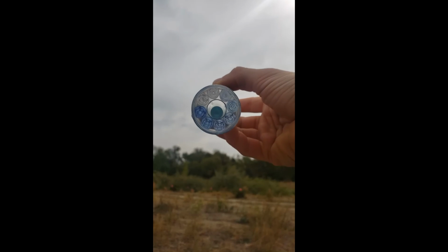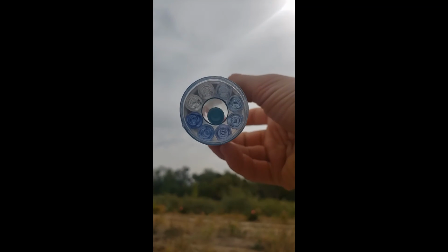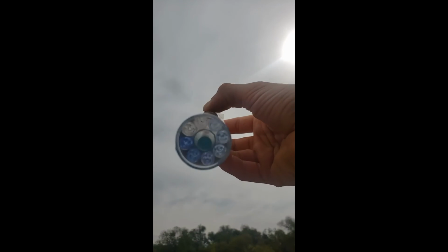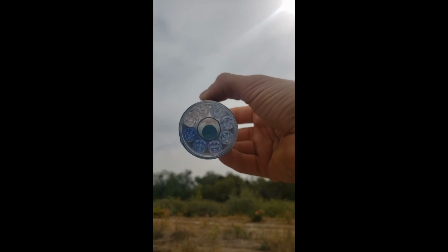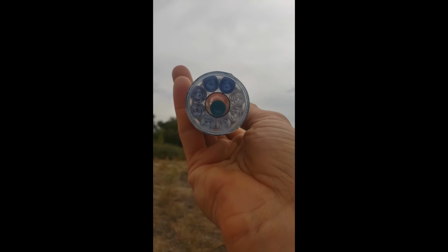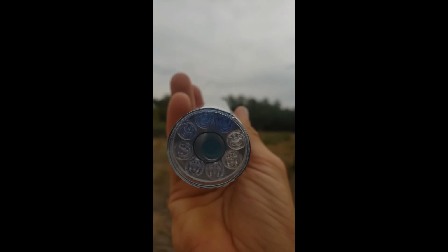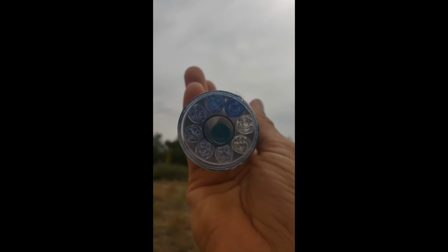It's hard to tell, but you compare this to the colors around it. Oh yeah, you can actually definitely see a color change. So I'm maybe gonna make the decision, ooh, it's like a different color blue, but it's a little bit darker. So I'm gonna go around and see that darker blue is at 0.8. See if you can see that. This goes to that. Alright, and if this is getting frustrating that you can't see it in person, come out tomorrow if you're in the Salt Lake area, and we'll do this water monitoring together.